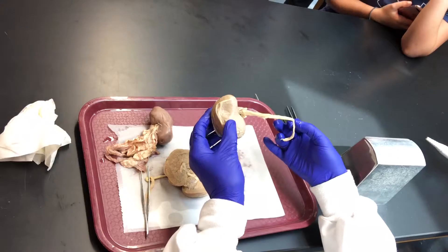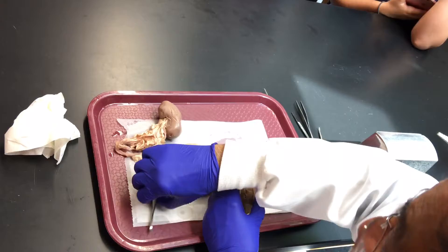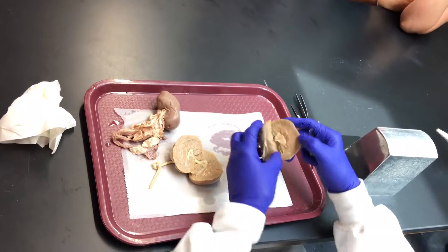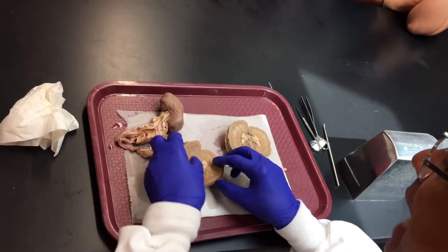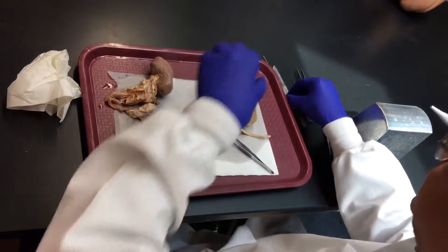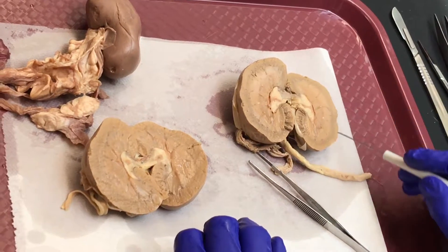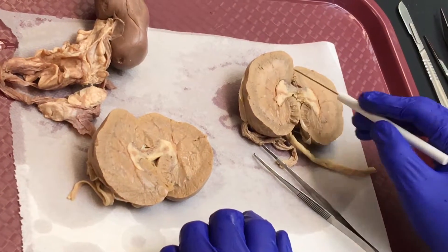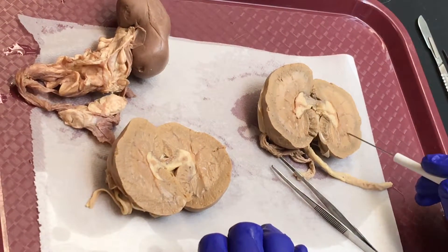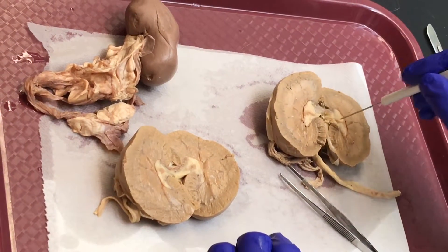So this is one structure you need to know — the ureter. Another structure is the renal capsule. When you make a section, you have the renal cortex, then the renal medulla, where you can see the renal pyramids, and this is the renal pelvis.